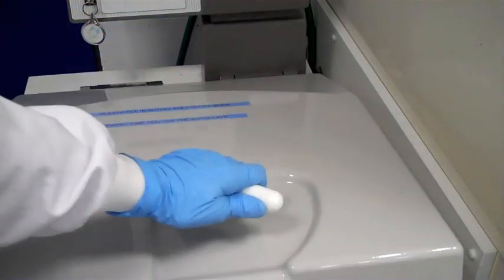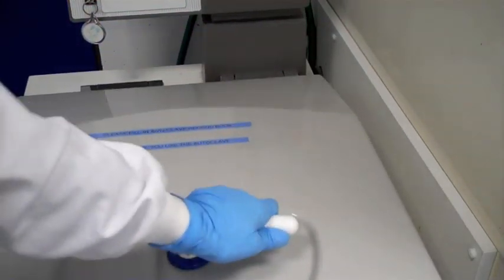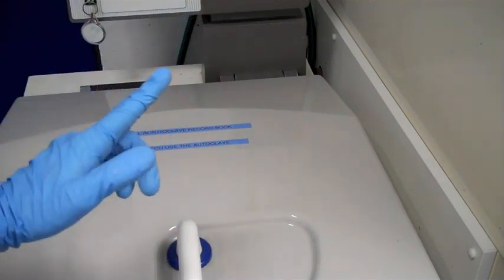Close the lid. Move the handle so that it engages. Close down. And you'll hear that click noise. That click noise now means that the autoclave is actually ready to work.